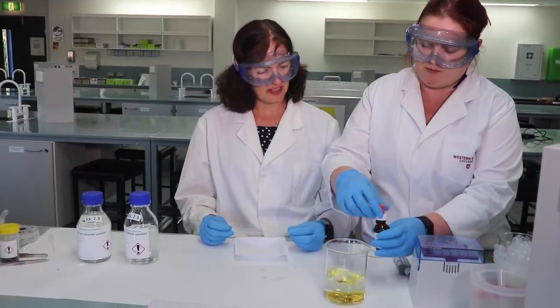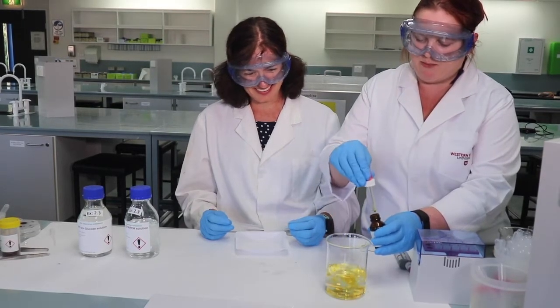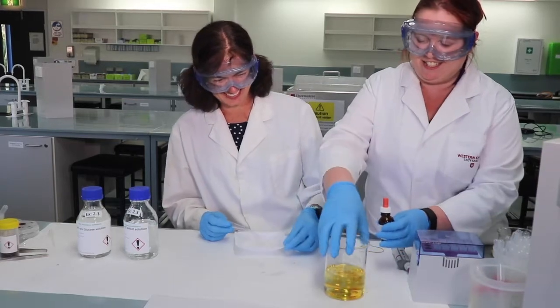I'll just add maybe one more. We want this to be a nice amber, like you see here.